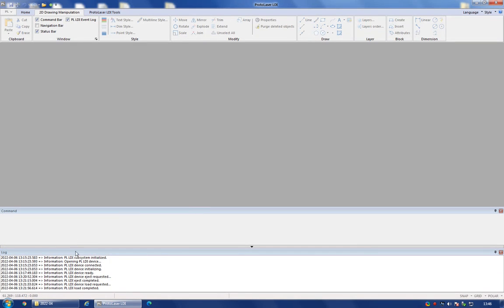It will have a log of all the things that have happened with the instrument itself, and you can see that earlier on for the fabrication, we have ejected the sample tray, the ejection was completed, and then we loaded our own sample, and the load was completed as well.